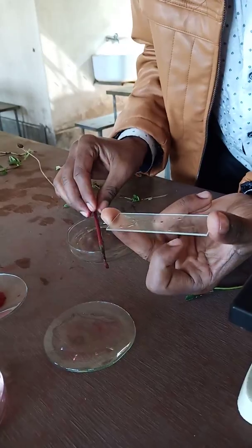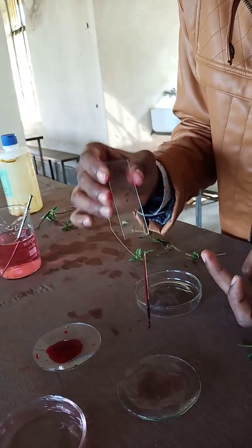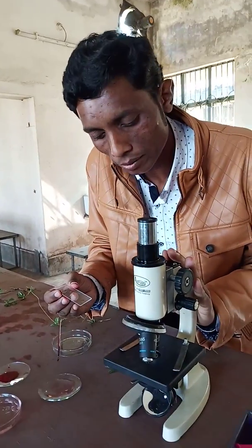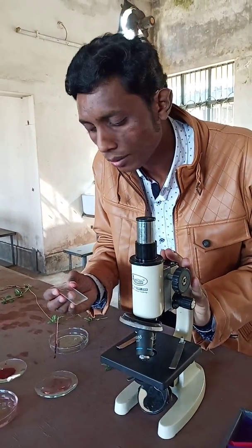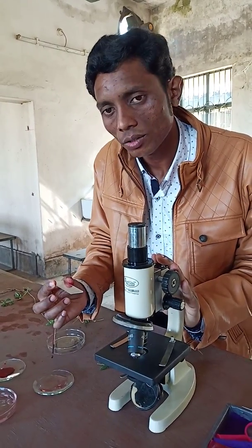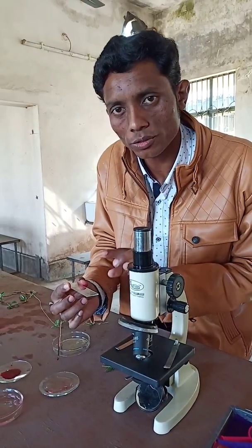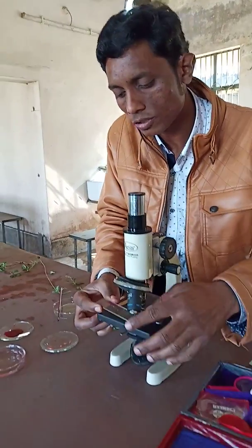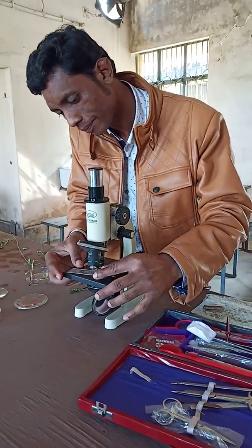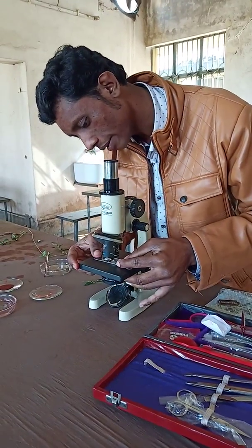Now we are going to observe it under the compound microscope. We will put this slide with the specimen — that is the TS of the stem — on the stage of the microscope, securing it here with the clip.